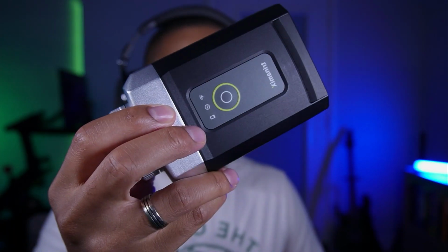But in today's video, I want to continue on the journey of assessing measurement quality, and in particular, applying the techniques that we discussed in previous videos like correlation analysis to understand how well our measurements were performed. We're using data that I collected from this portable infrared spectrometer to actually move the data forward. And so I want to show what the data looks like and how we're going to apply the correlation analysis to filter this data. So let's get started.